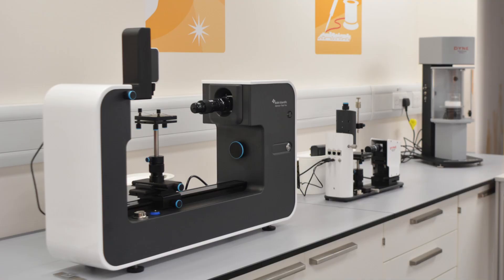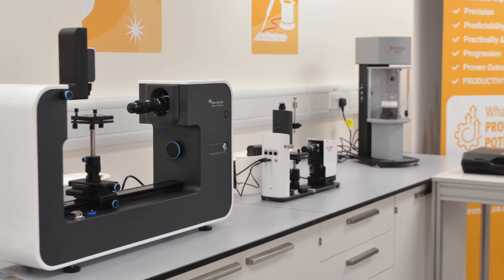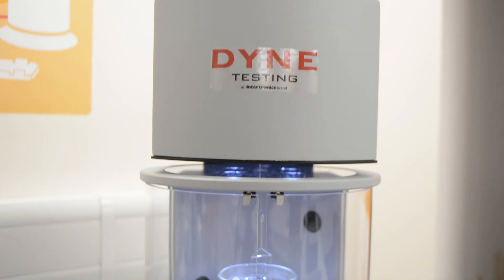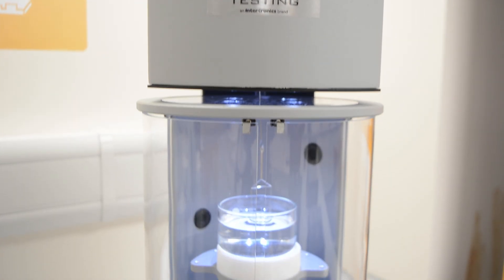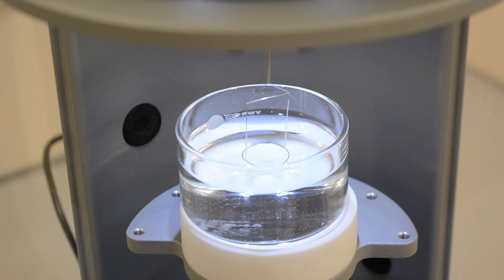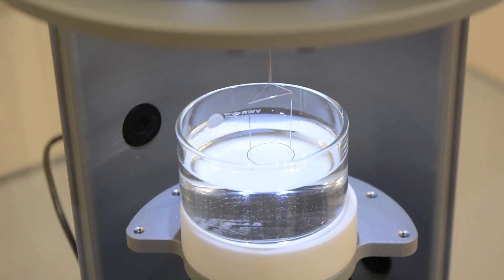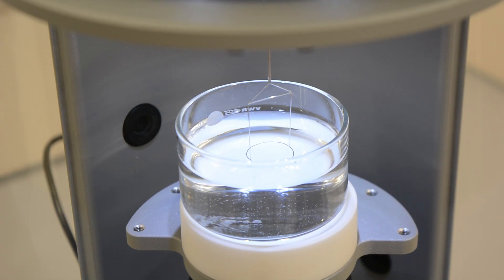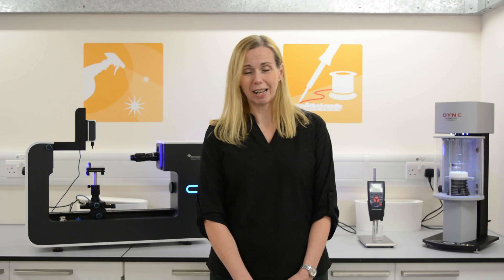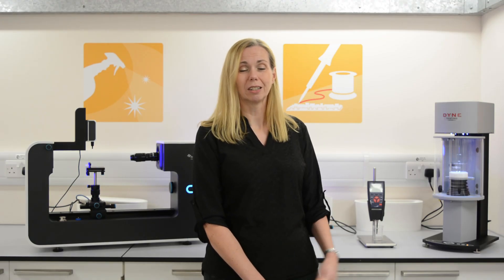The instrument is designed to support these various measurements depending on what you're looking to measure. For example, when measuring surface tension you have the option of a force tensiometer, which measures surface tension by determining the force required to detach a probe or ring from the liquid surface — and that force is directly related to the liquid surface tension.